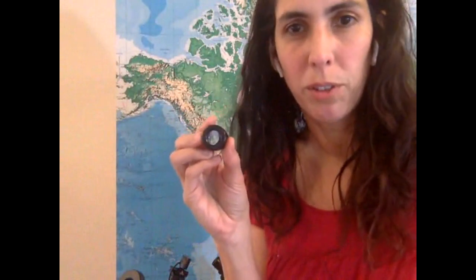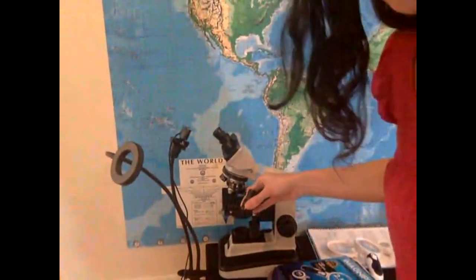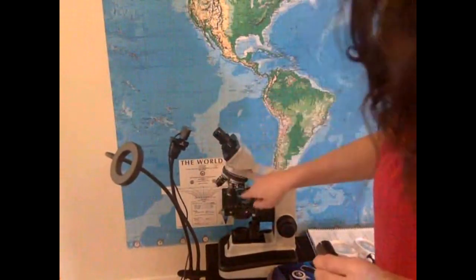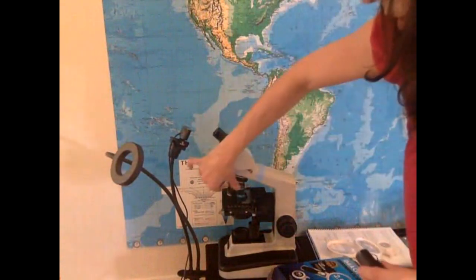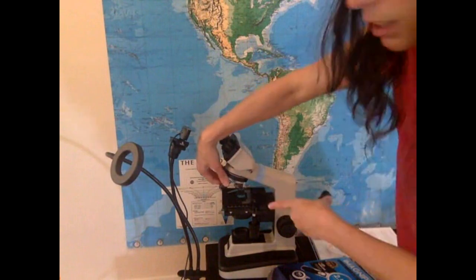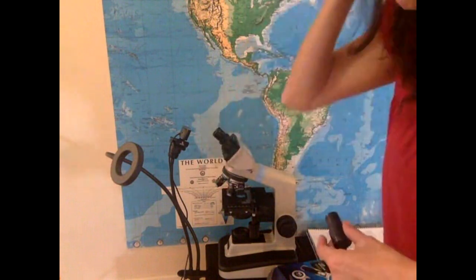But not every microscope is going to have the ocular be 10x. Most of them, but it could be 15x. So for you to know the total magnification of a sample that you're looking at, you need to see what is the magnification of the ocular, and then you need to see what's the magnification of the objective that you're using. So if you start with your lowest objective, it says on the side 4x, might be too far to see, but it says 4x there. So it says 4, 10, 40, and 100.